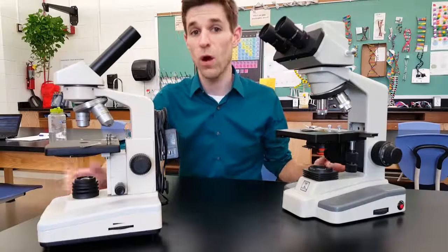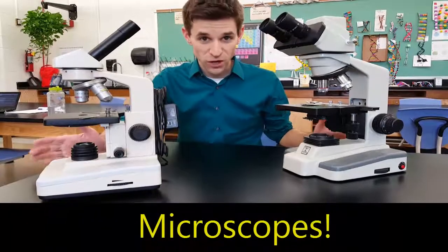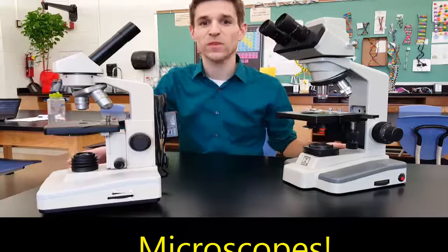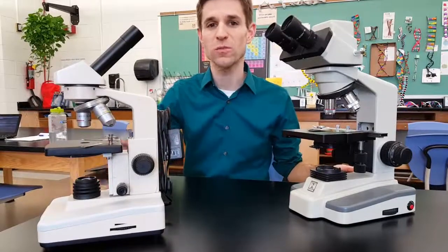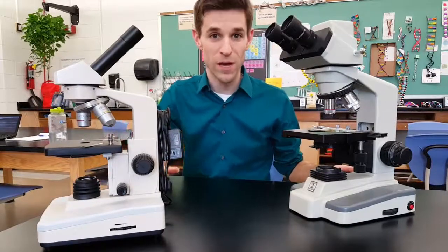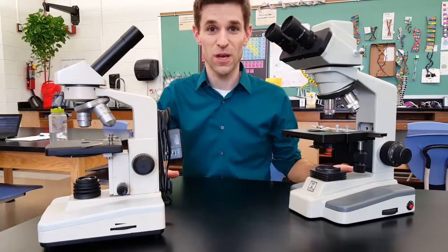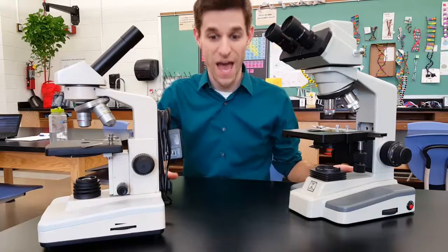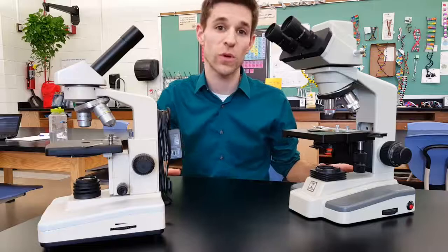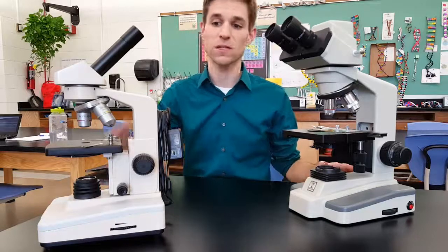Hey everybody, this is our video all about microscopes. Mr. Johnstone is very passionate about the use of microscopes, and you must use microscopes the right way in biology class, or Mr. Johnstone will not let you use microscopes at all. So this short video is to acquaint you with our microscopes, and we have two different kinds.